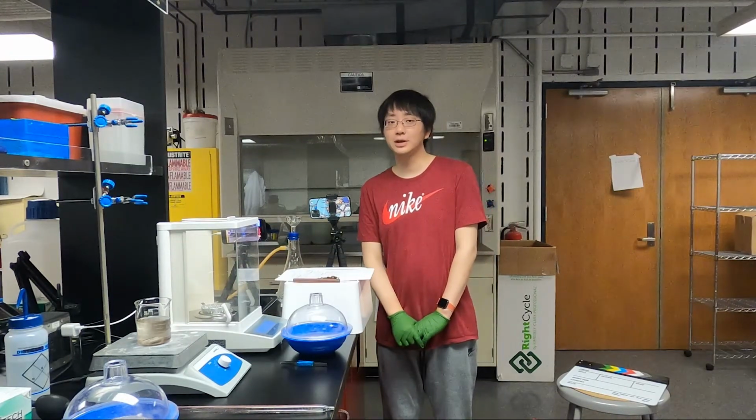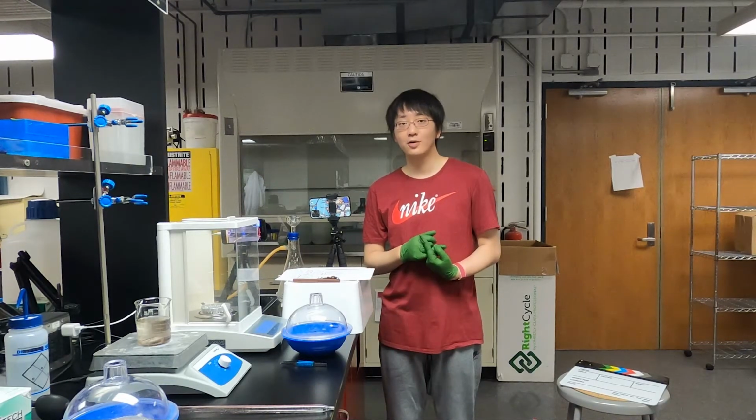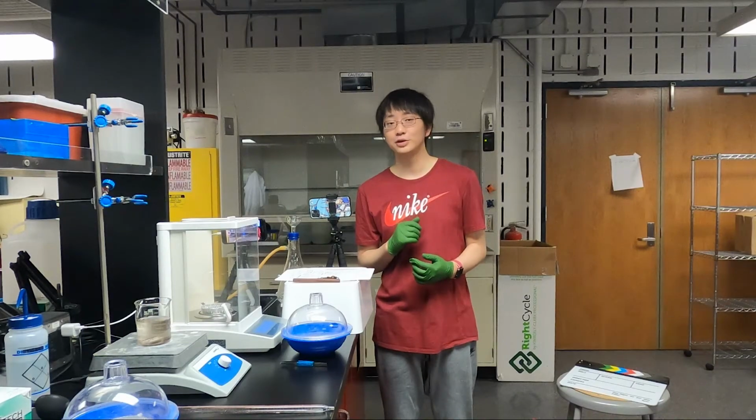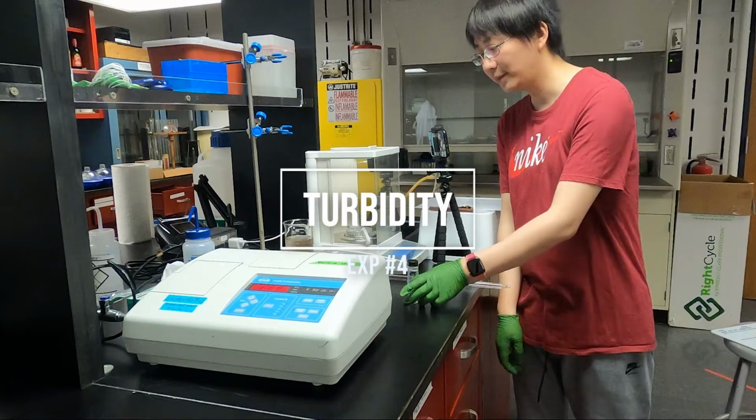So this is for the suspended solids. And now we have all of the solids data. And then based on this data, we can do the calculations. Now we are going to measure the turbidity.